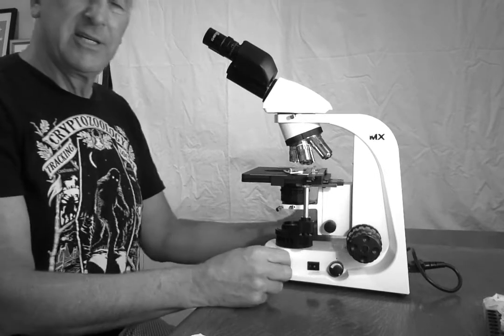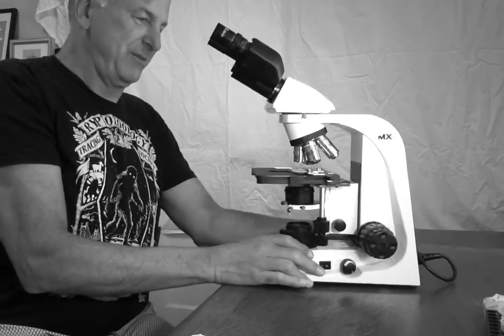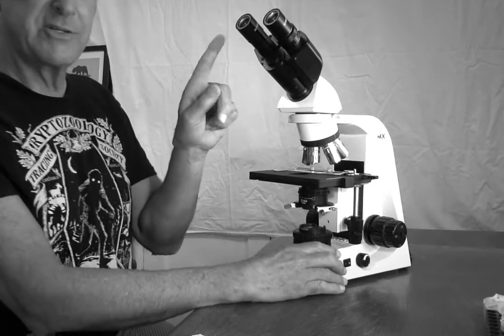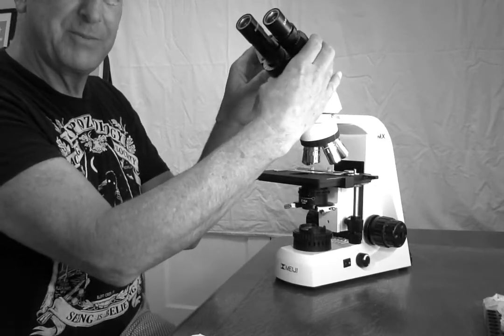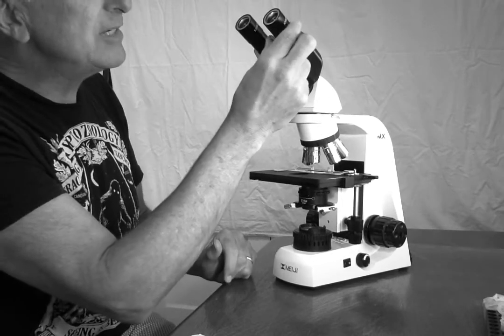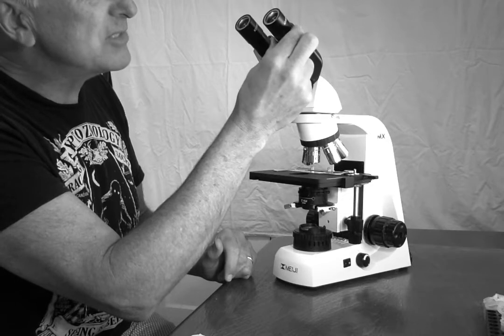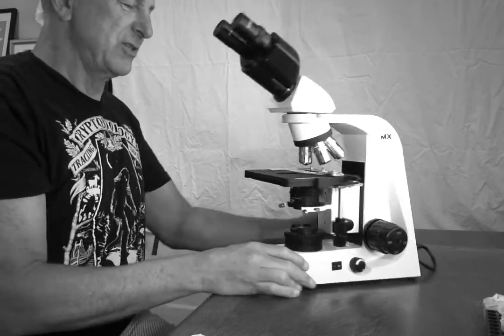But this is a chance to do one more adjustment that fits me personally. This is a binocular microscope. It adjusts width for different people's eyes and heads. It also has one lens, one of the oculars, that can be adjusted, so we can adjust each one for different people's vision.